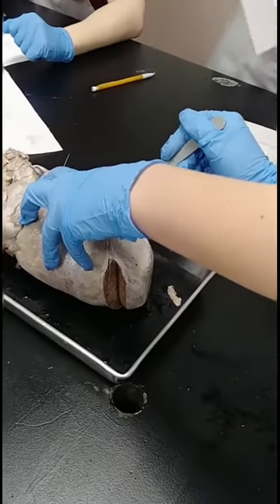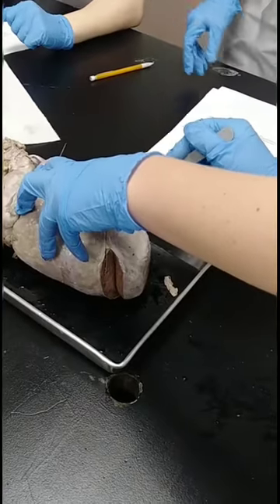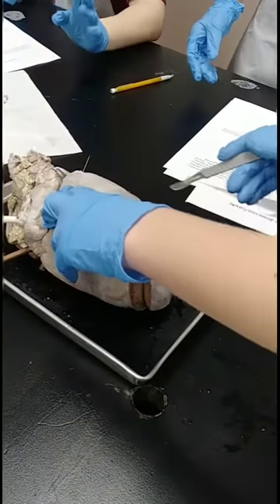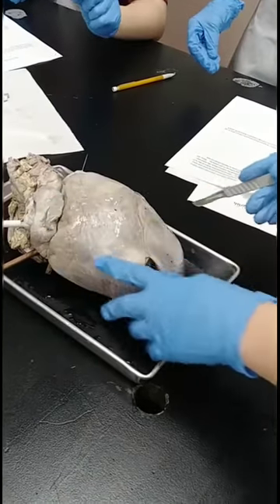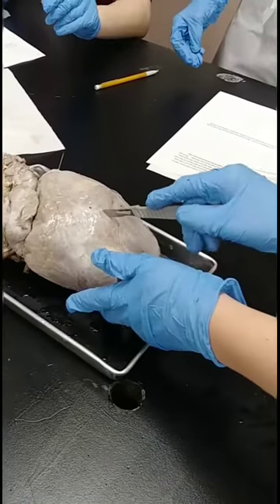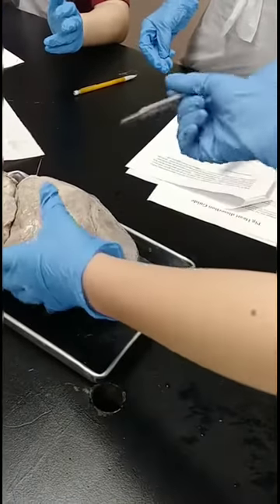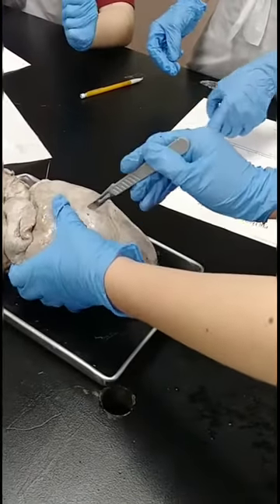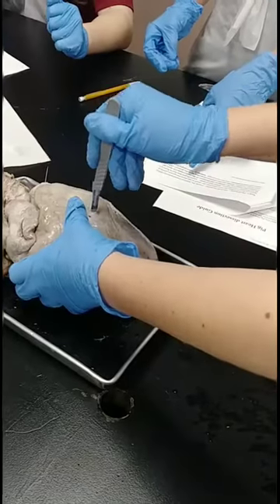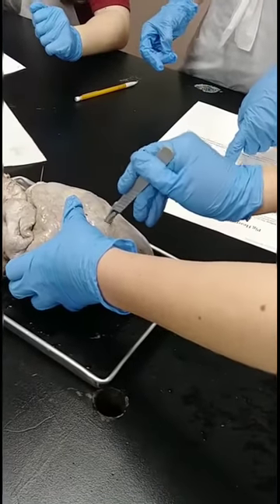That's the left ventricle — just cut it. Find the septum — the one separating the left and right. That's right here. Cut it open, your left ventricle. We found that.